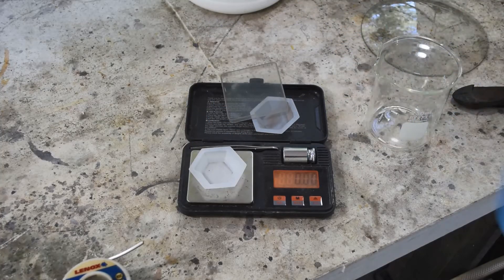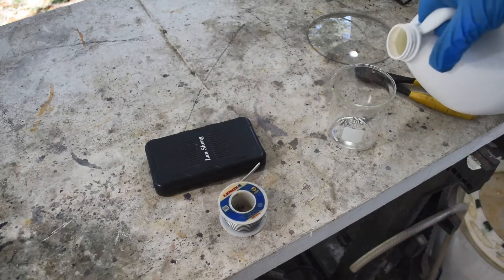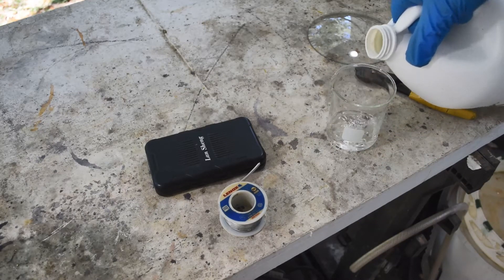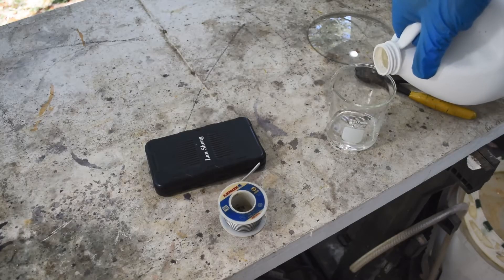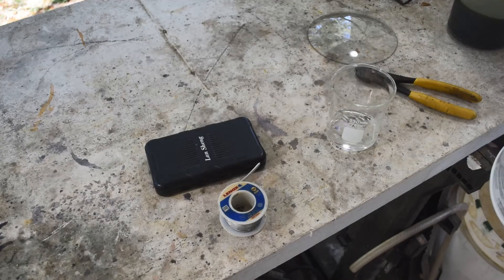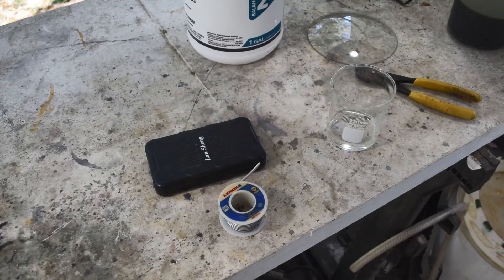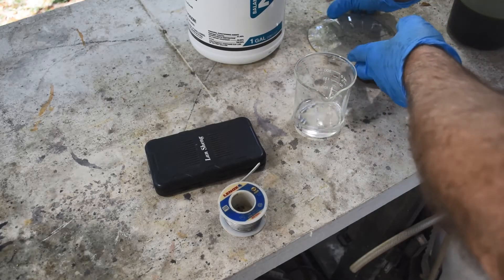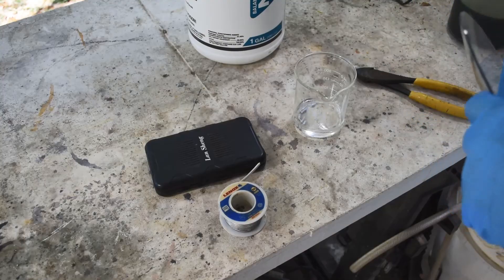I put the solder pieces in a little beaker, and next we need some muriatic acid. We add about 50 milliliters of muriatic acid in here — right about there. Now we just need to wait for the solder to dissolve.